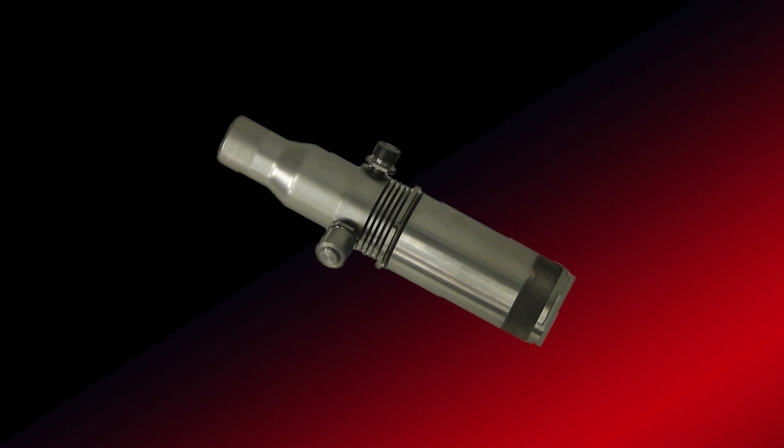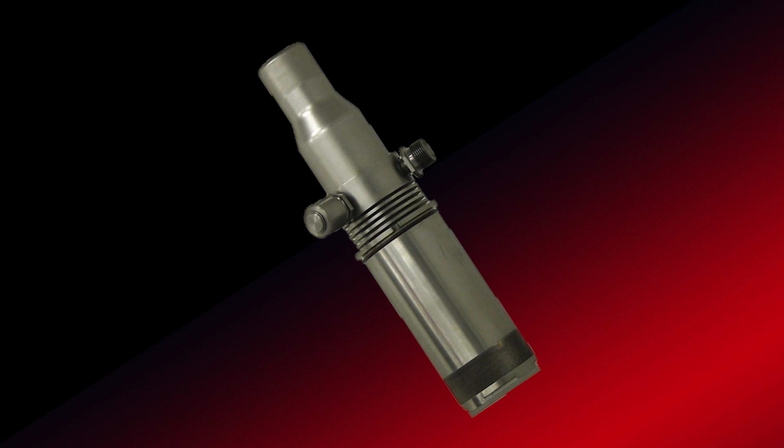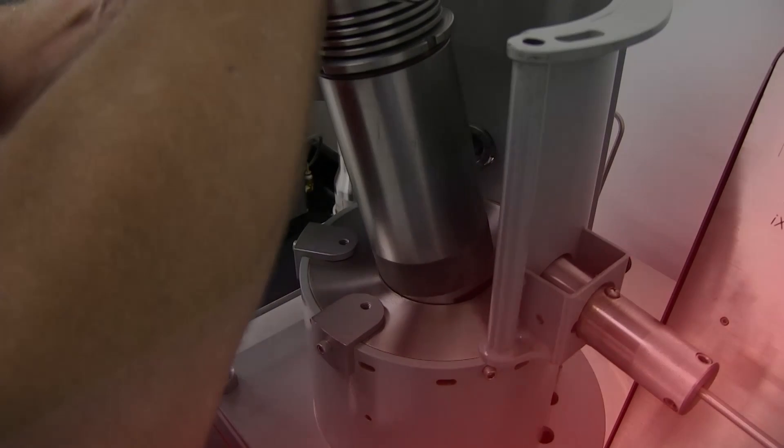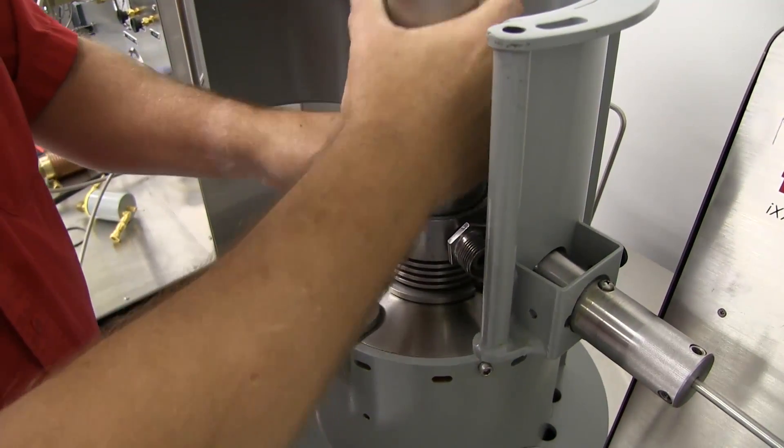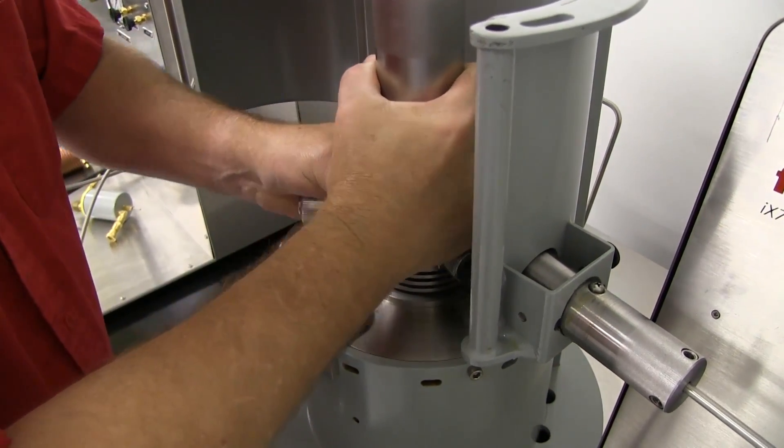After the cell is assembled and filled with the fluid sample, the user loads the desired test sequence, or generates a new test sequence if that's required, and simply clicks the Start Test button.